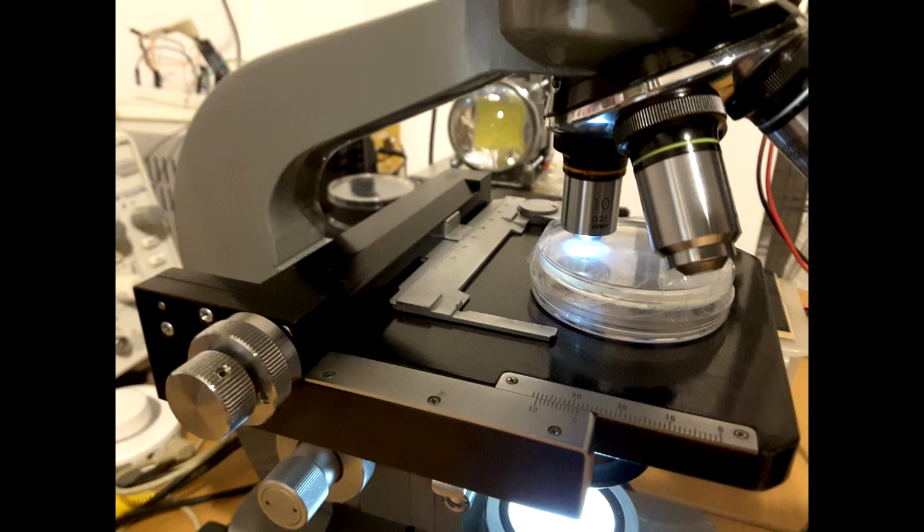With the one contaminated from the computer mouse, I let the culture develop in a closed, darkened environment for a few days, until signs of culture development became visible to the naked eye. Then I prepared a microscope and the camera for long-term shooting of periodic photos to create a time-lapse video that you will see next. It took roughly 24 hours to create these images.